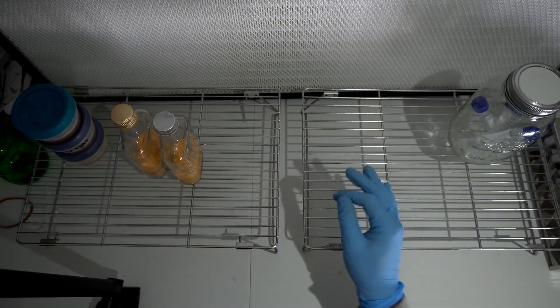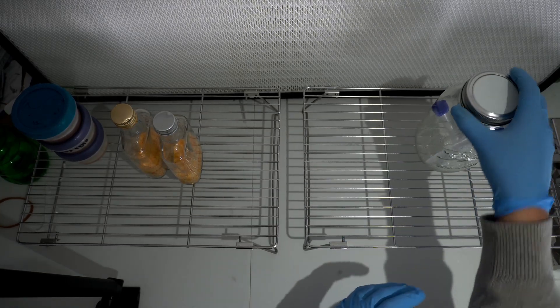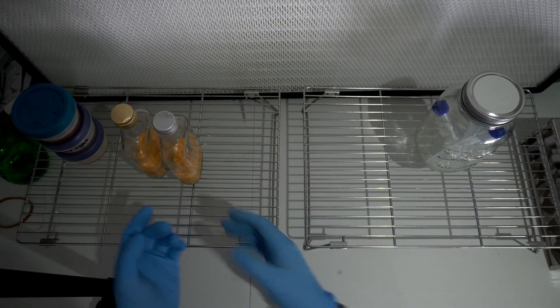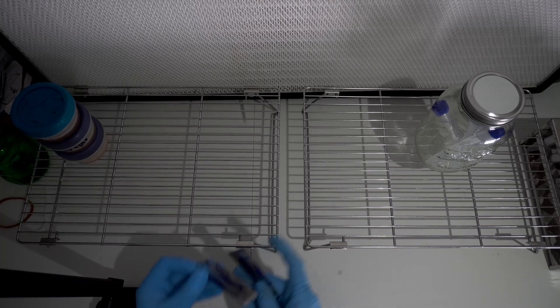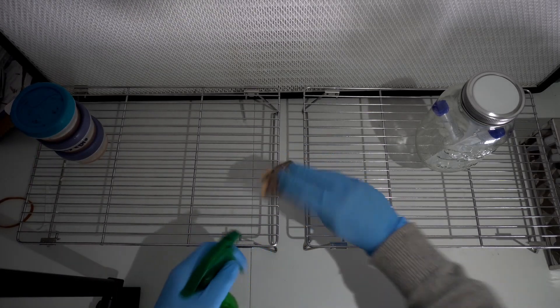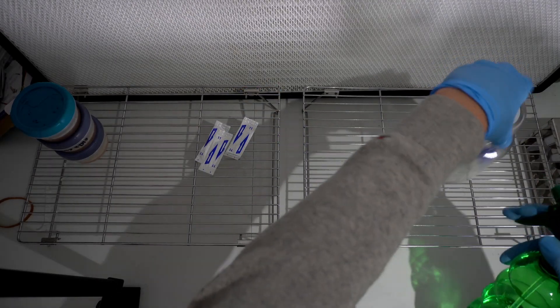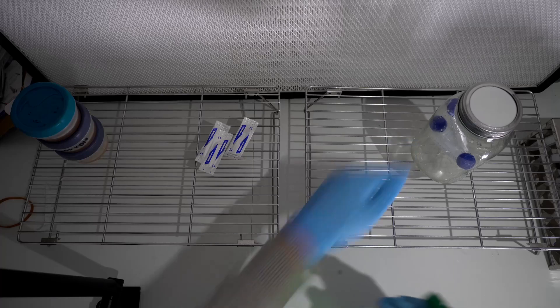It's very simple — we're just going to take a small piece of tissue from the pots on the left and then place them into the vials on the right. I'm going to be using three blades, taking them straight out of the sterile packaging. I'm not going to reuse any blades because I don't want tissue from the different pots getting into the different vials — I want to keep all of the vials and the cultures and the genetics separate.